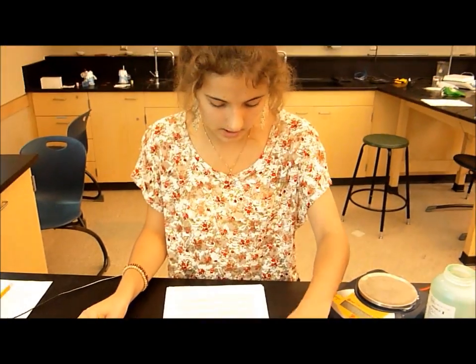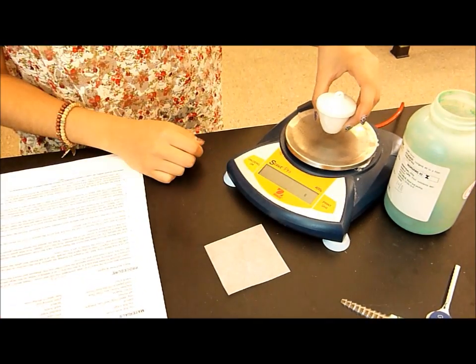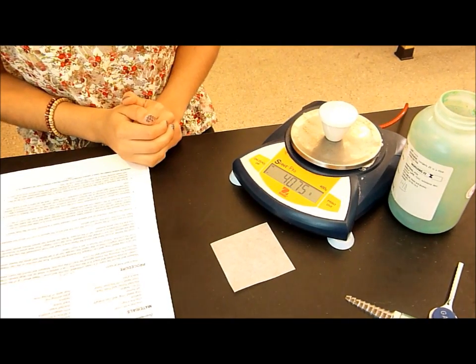And now, measure the entire crucible with the copper chloride, and record that mass.